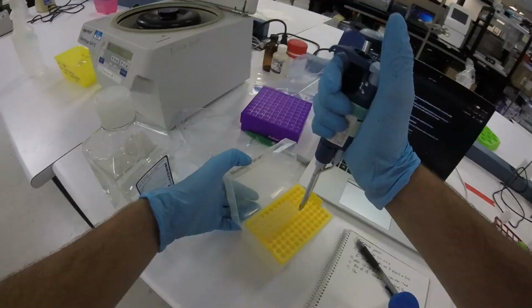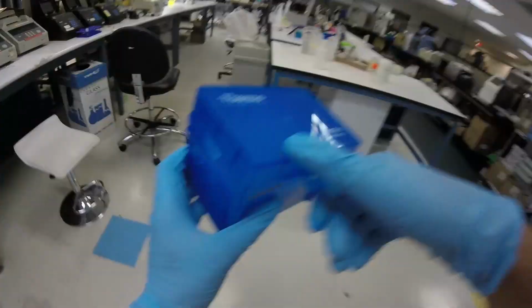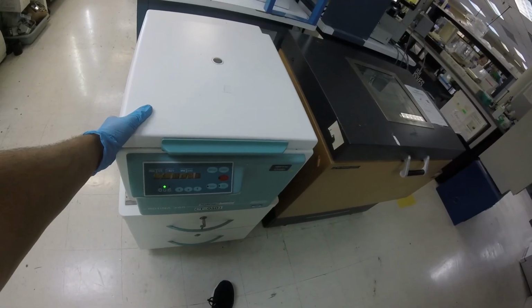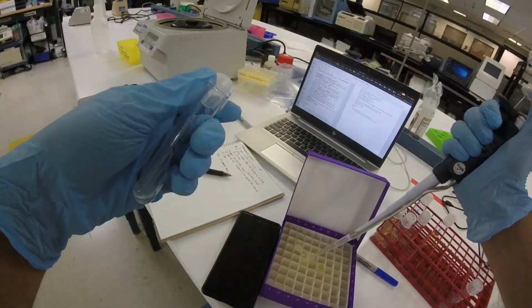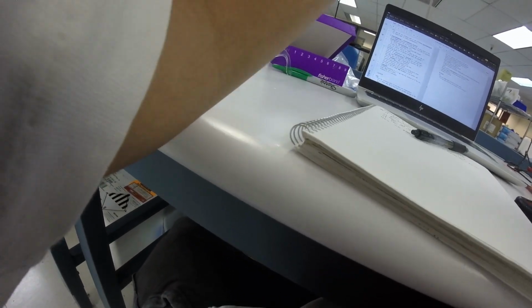One thing I should say is you can use 1 microliter of plasmid, and that doesn't really make sense unless you know the concentration of plasmid. I actually streamed from here for the first time. It was pretty fun. I couldn't really use the webcam all that much because I didn't want to get other people in it. But we did the math and figured out that given the concentration that I had of plasmid, about 100 nanograms per microliter, and that the P-Glow plasmid has about 5,300 base pairs, in 1 microliter there's about 16 billion plasmid molecules. That's a pretty high concentration, and for electroporation you really only need 1 microliter. But for the heat shock, you needed like 10 microliters, which means 160 billion plasmids. So the transformation efficiency is quite a bit better.